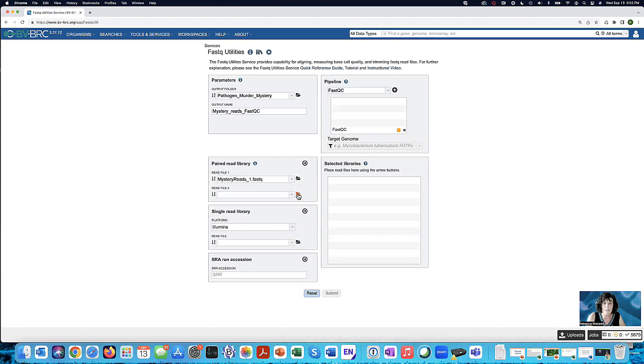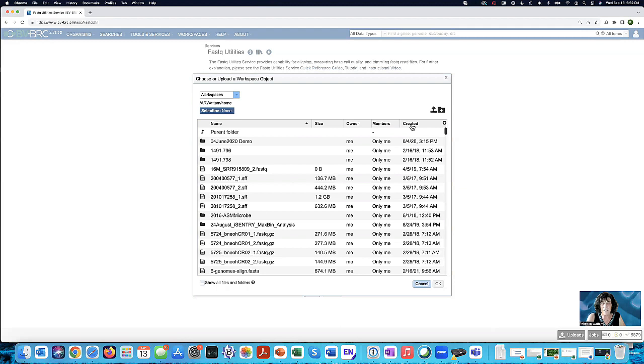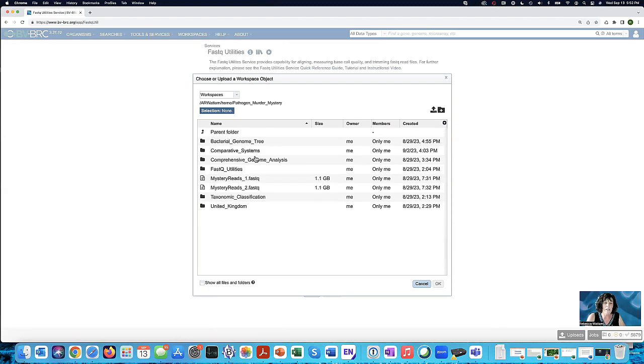And I'd have to do the same thing again. Click on the folder icon. And I've got a lot of stuff in here. So I know I created it pretty recently, so I'm auto sorting by creating on this last column head. And then I click on this, but wait, before I do this, what if I wanted to upload something else? What if I didn't want to do this?